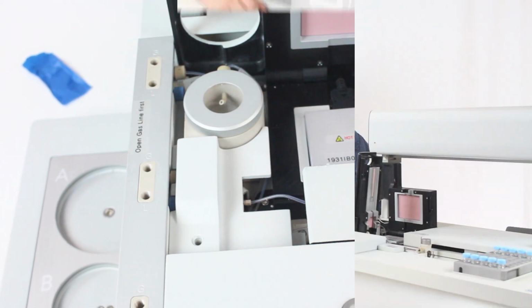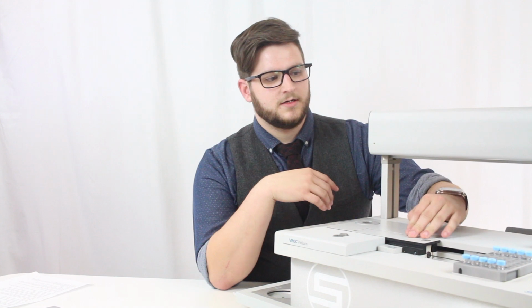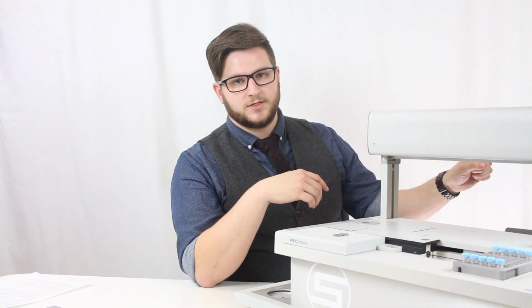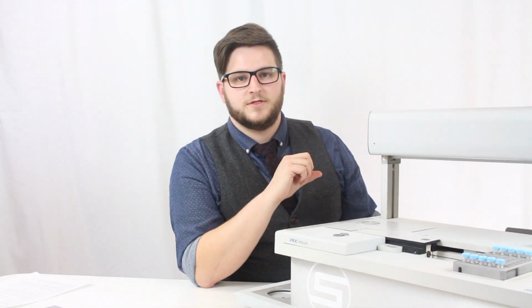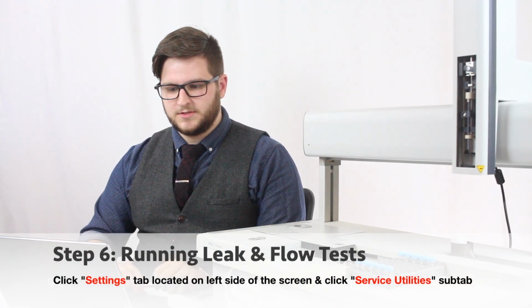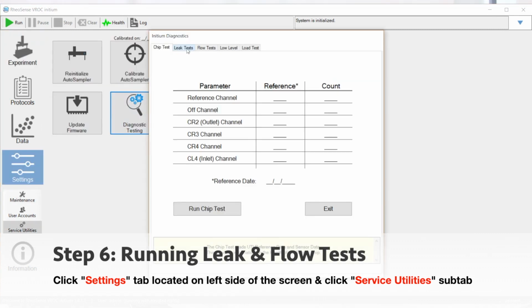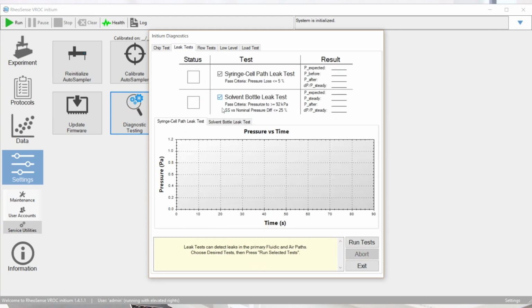Now that you have your new chip in, you can close both of the lids and turn on your unit, and then next is going to involve the computer and going to the Initium software. So once you have your Initium software open, you're going to want to go to Settings, and then under Settings, Diagnostic Testing. You're going to then go to the tab Leak Tests, and you're going to deselect the solvent bottle leak tests. This will cause the syringe cell path leak test to only be tested. You can then start the test by clicking the Run Test button in the bottom right corner.